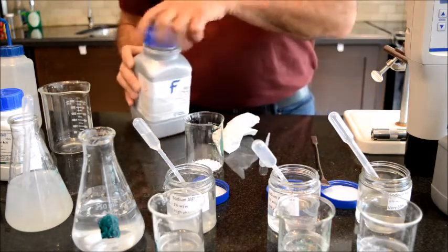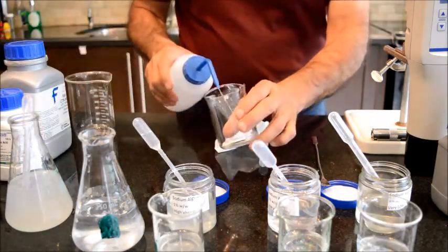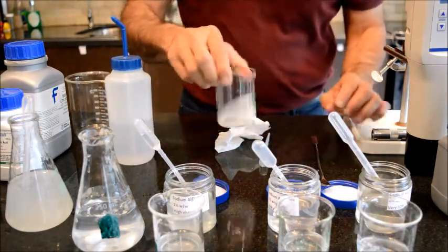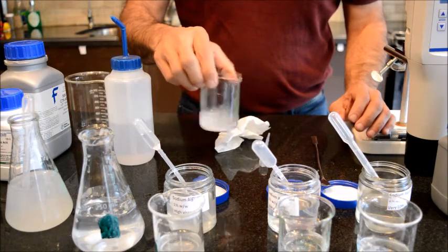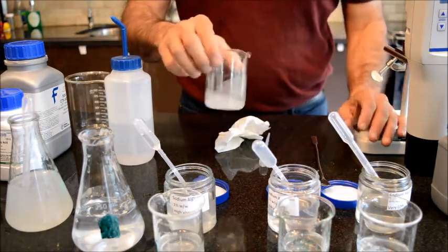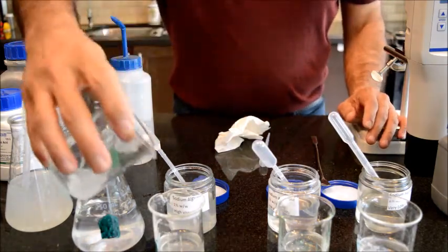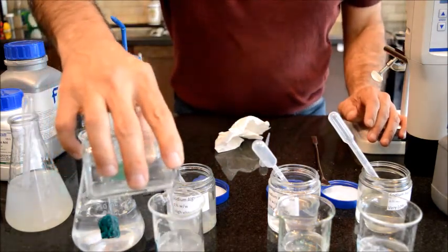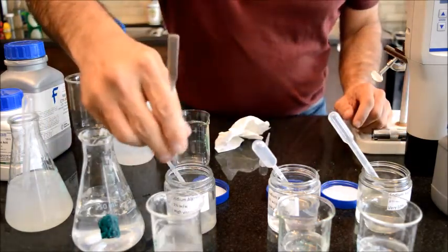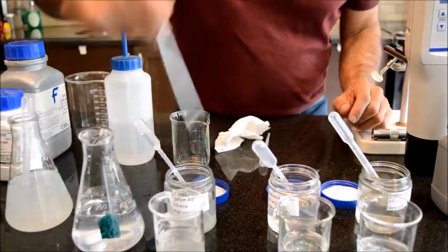And for sure, now if I add it to the high viscosity alginic acid, the polymer that I'm going to make would have a higher density than the other ones. And also it does matter how much calcium you're adding. So I add a little bit here. Again, it immediately forms some solid material. Solid material is like a goo, right?